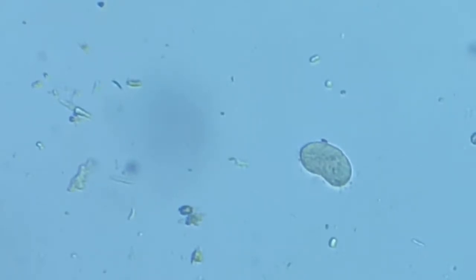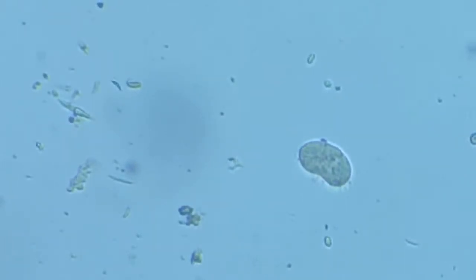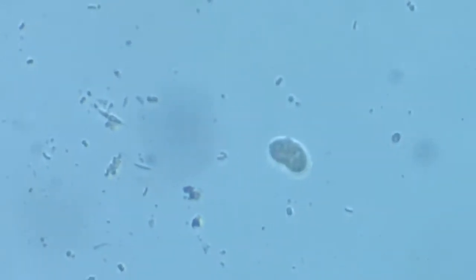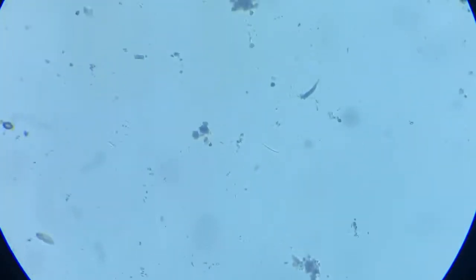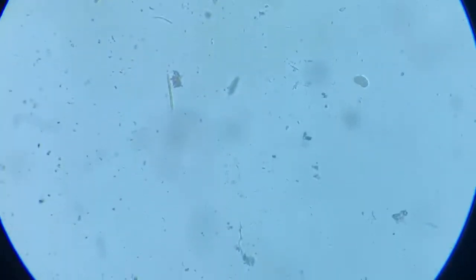Okay, this again is surely something organic, and has some cellular components inside, but exactly what it is is difficult to manifest for the time being, and hence we leave this aside. What was that? Paramecia.